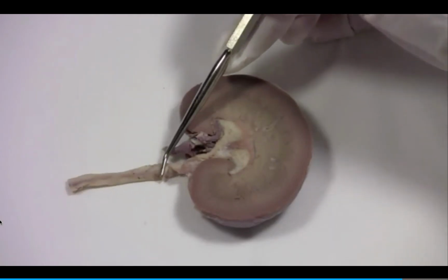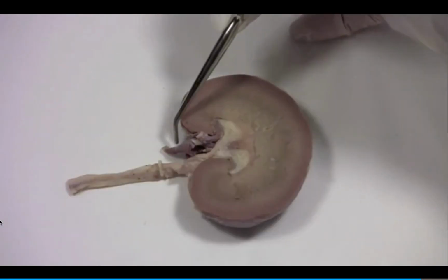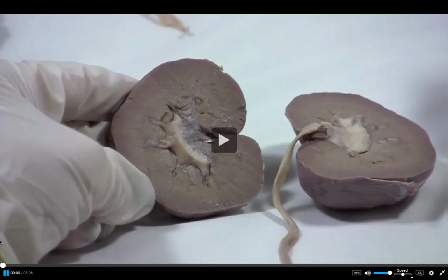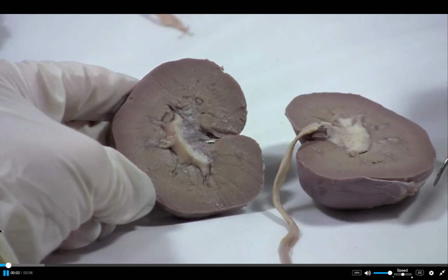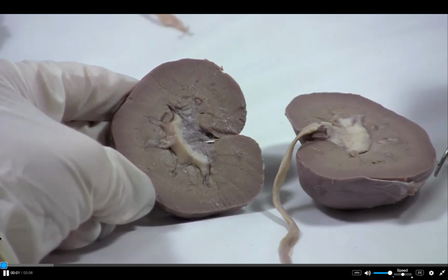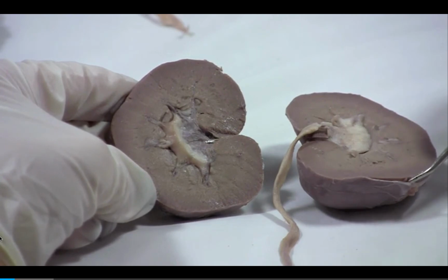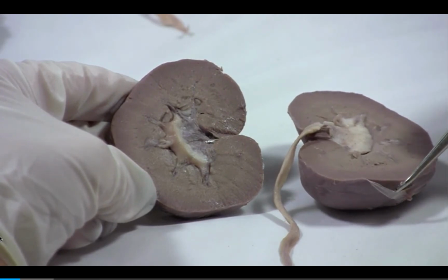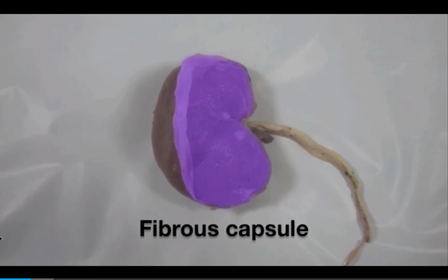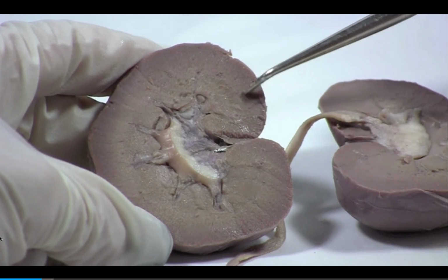This is the ureter, and this is a renal blood vessel. Taking a look at the regions of the kidney from superficial to deep, we can see the fibrous capsule. The renal cortex is the outermost region of the kidney.